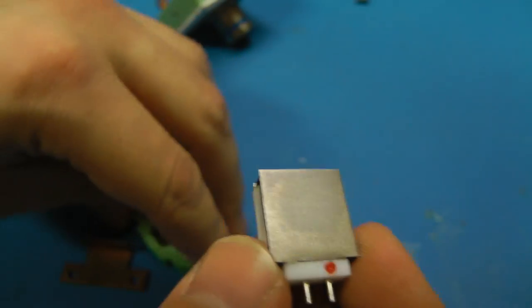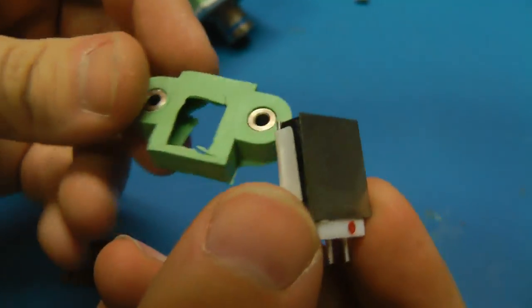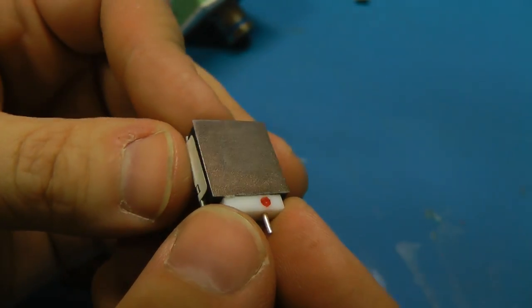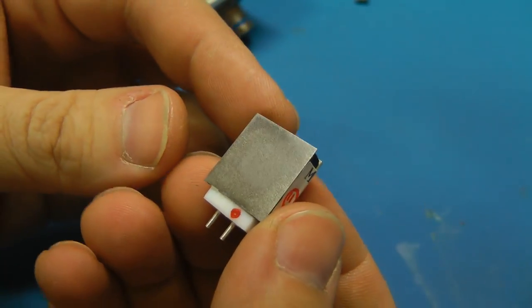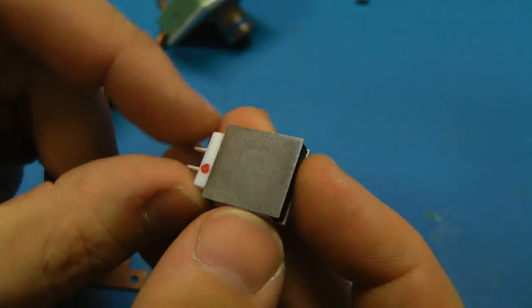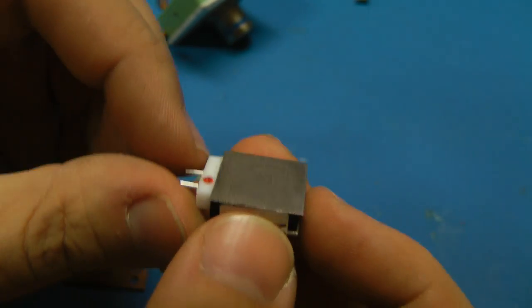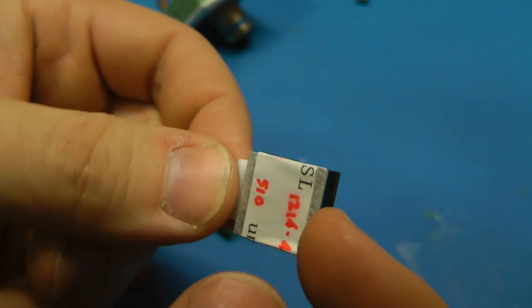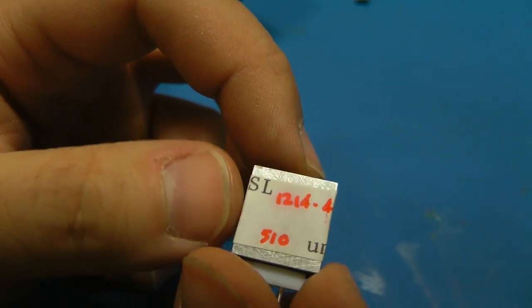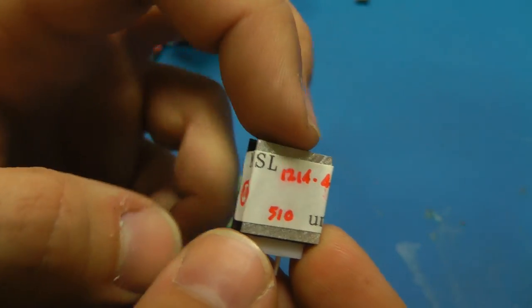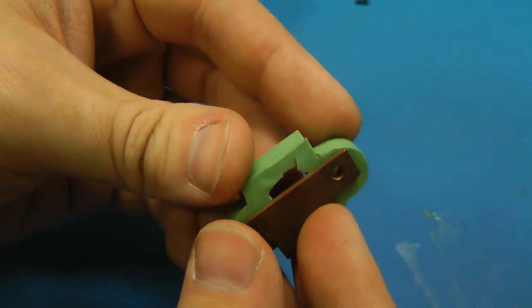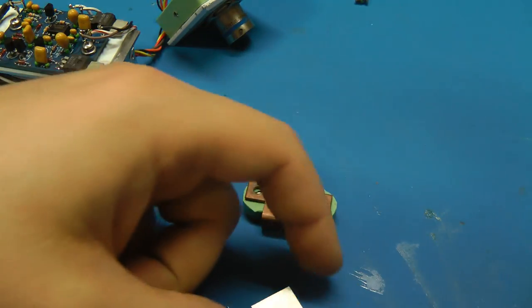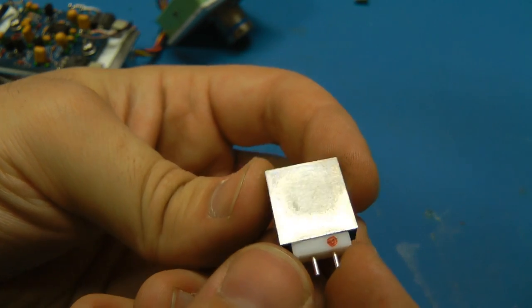So here's the X-ray detector outside of its little shoulder shell thing, which looks very, very homemade. From what I can tell, this is a silicon PIN photodiode inside a container with a beryllium window. Some other X-ray sensors I looked up say they have beryllium windows. And this looks the right color. So I'm not going to go and break that because it could be quite dangerous to breathe in anything from it. But judging by the slight curvature, I have a suspicion it may be under vacuum. There's not much on the back. It says MSL 1214-4, 510 micrometer. That might be the size of the detector potentially. This copper shield is behind it to protect it from X-rays coming directly from the source.